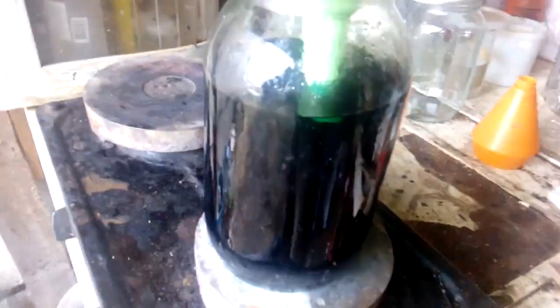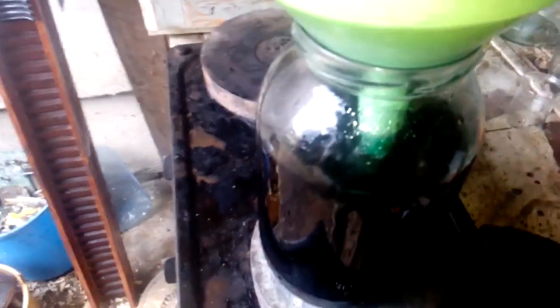Now I'm going to neutralize with urea. Our solution is almost filtered. This is water from the rinsing and this is what is left. No gold on that finger anymore.